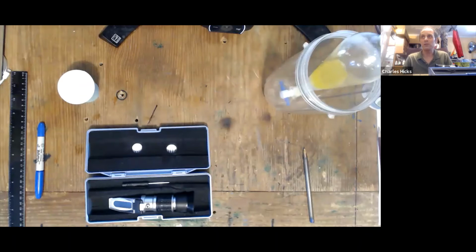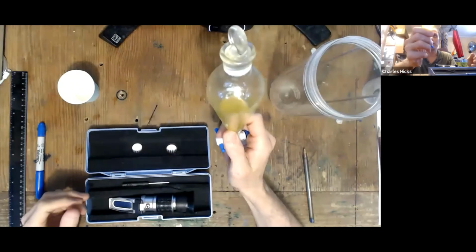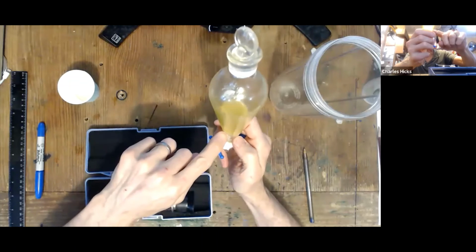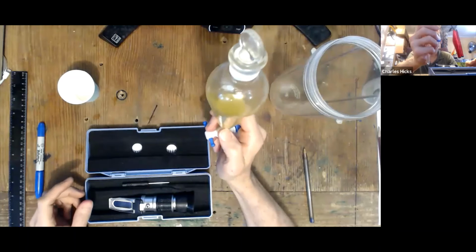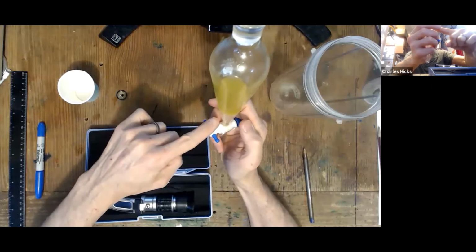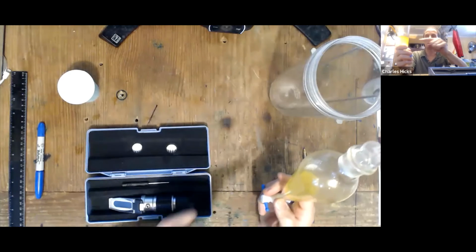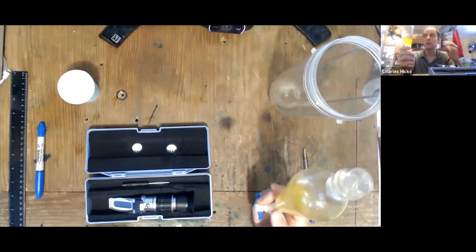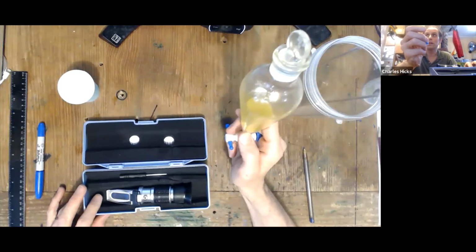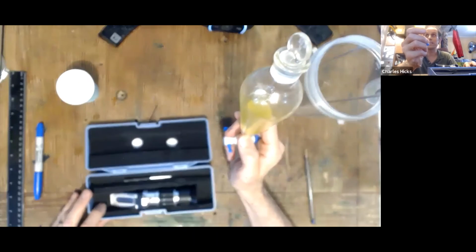Now, after a week has passed, the mixture you prepared that has the canola oil, the water, and the triethyl citrate will have mostly separated. You very likely will still see a little bit of emulsion in the middle, but this now has at equilibrium the 3 components. There is a distribution of some triethyl citrate in the oil and some triethyl citrate in the water, and that really is our goal to figure out today. We want to figure out what's the equilibrium constant that determines the distribution between those 2 layers, the canola oil water partition coefficient. So what we want to do is take samples of both this oil and water layer and measure their refraction in order to figure out what the percentage of triethyl citrate in each layer is.